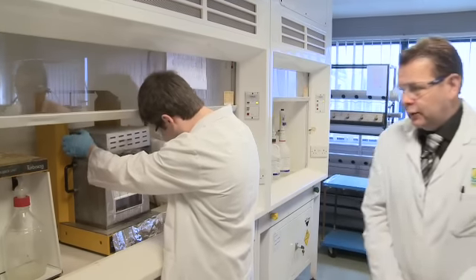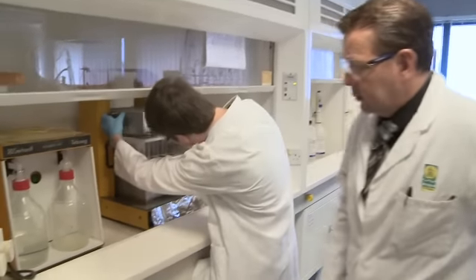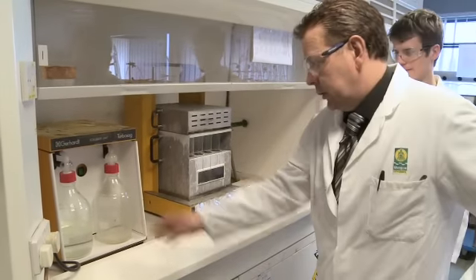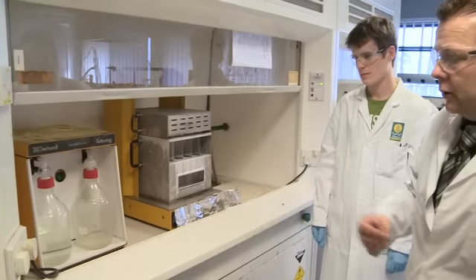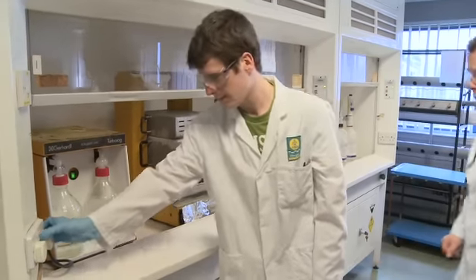The acid fumes evolved are then passed through these 2 vessels here, scrubbers to encapsulate any acid fumes, the acid going into a sodium hydroxide scrubber, and stop fumes getting put out to the atmosphere outside. The heating process can now continue.